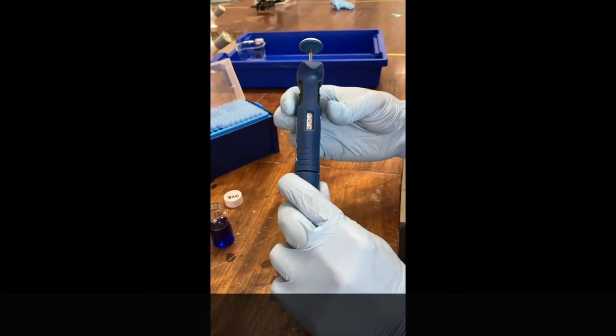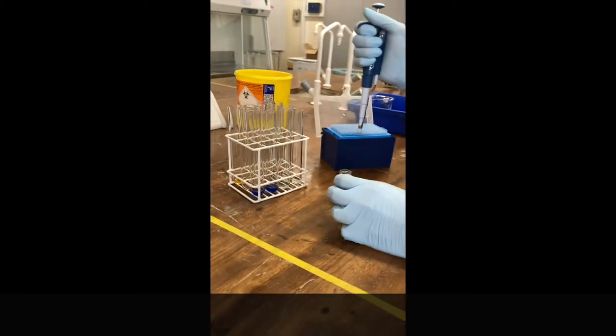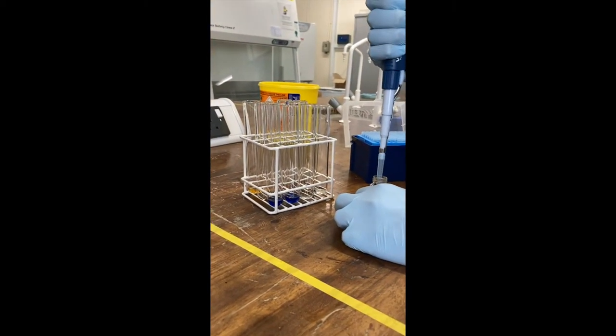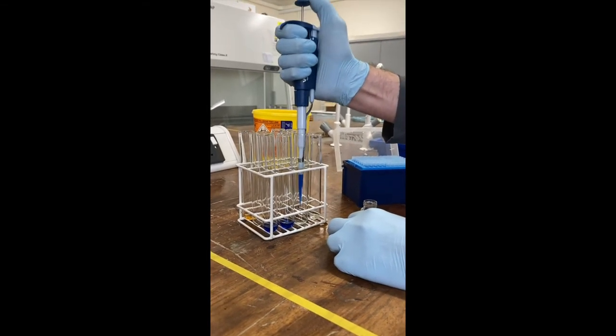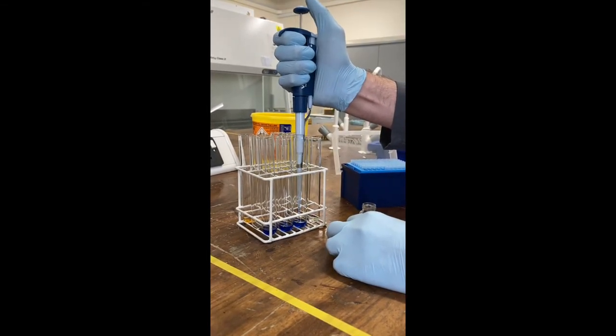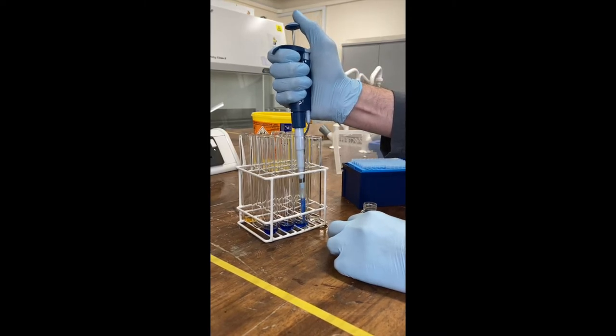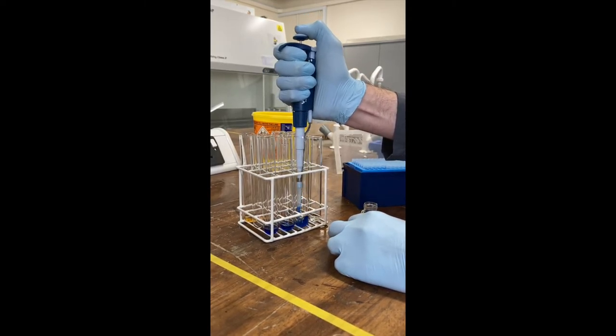So that's again, it's 100, which is one mil. Perfect pipette here. And pipette one mil in. Again, going down to the second stop, you want to make sure you just really keep it careful a couple times just to mix it.